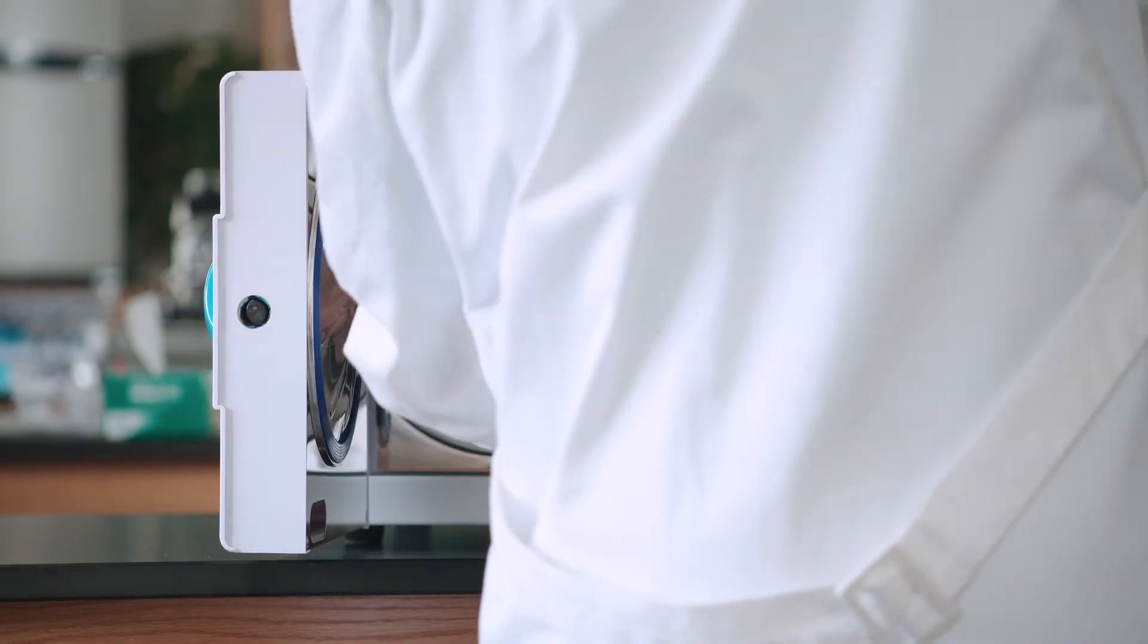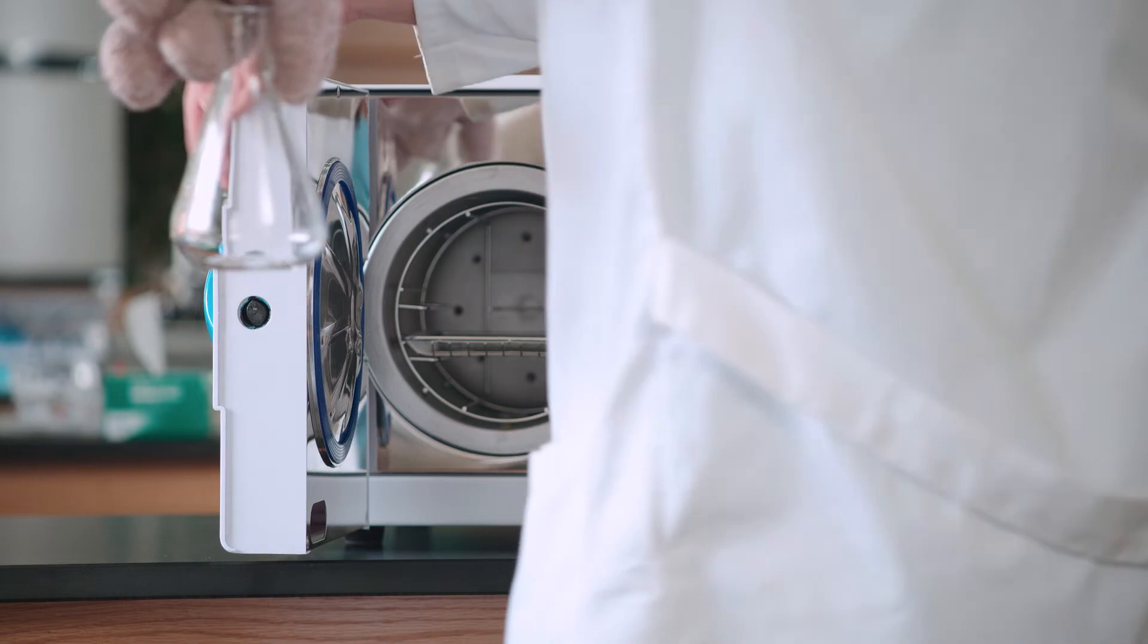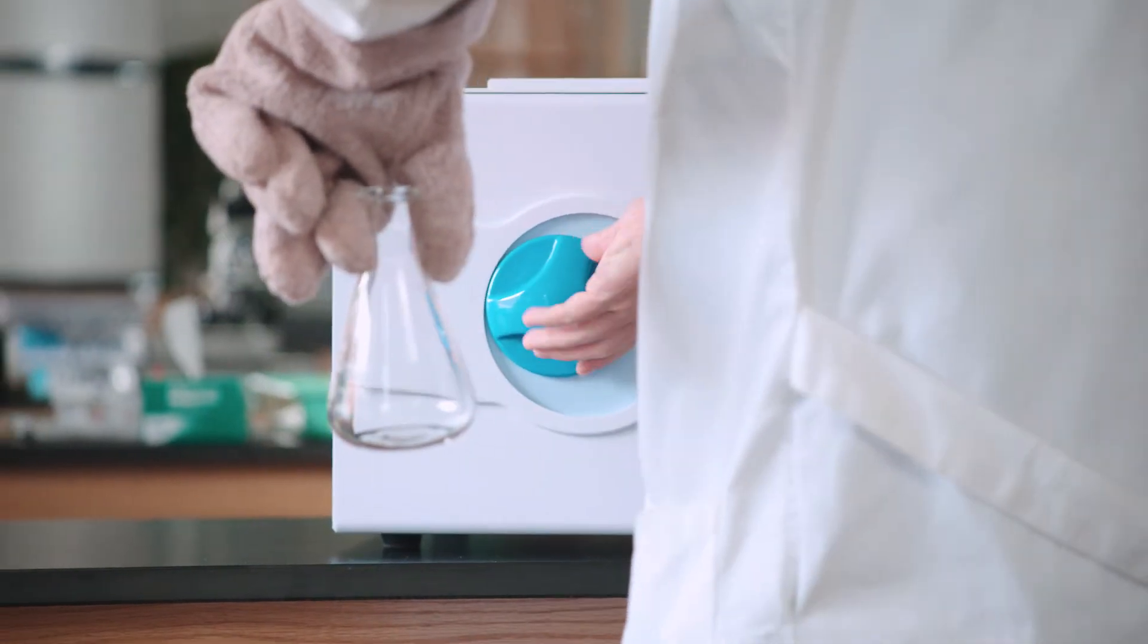If you do not have access to an autoclave or filter sterilization, pasteurize the media by heating it to 73 degrees Celsius for 10 to 15 minutes on two consecutive days.